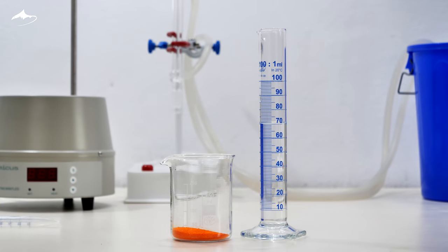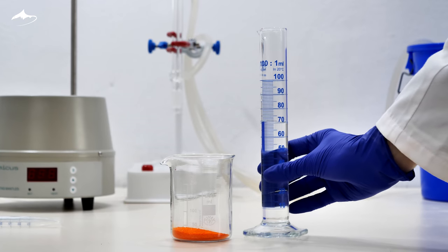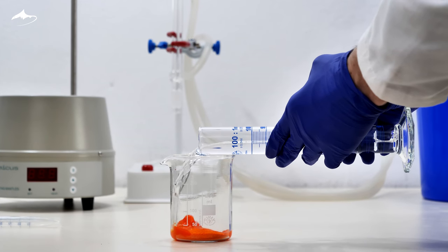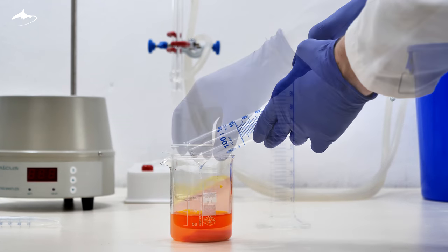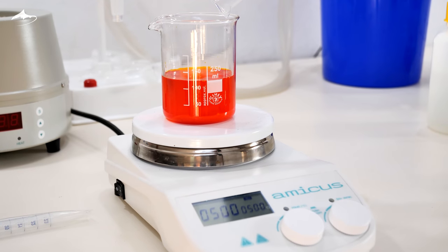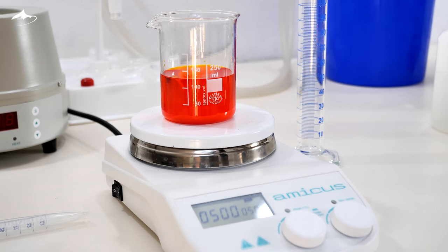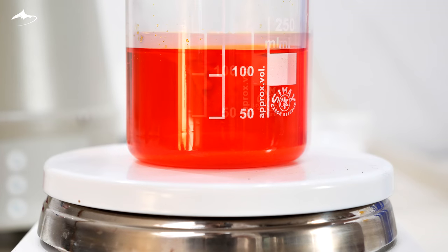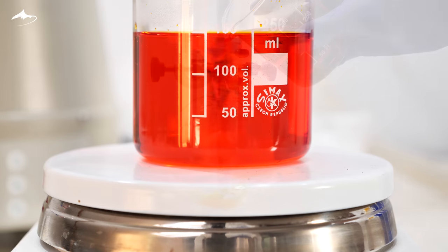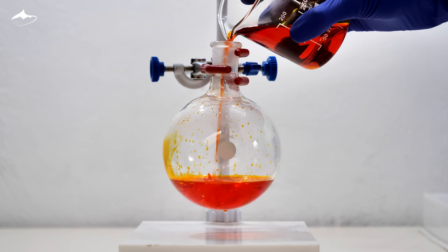The first step is to prepare the oxidant solution. For this, 36 grams of potassium dichromate is dissolved using a total of 120 ml of distilled water. Gentle heat is needed in order to completely dissolve it. It is then transferred into the reaction flask.